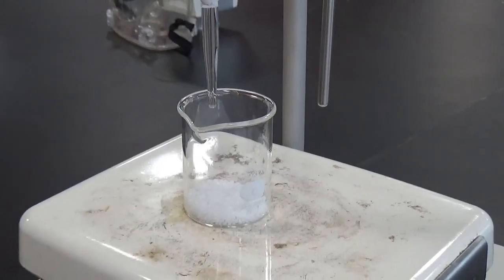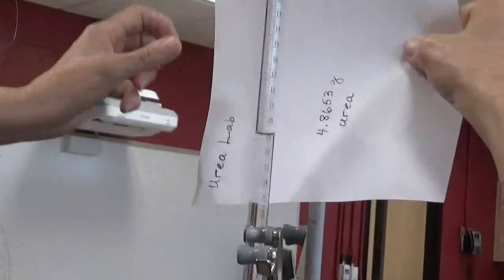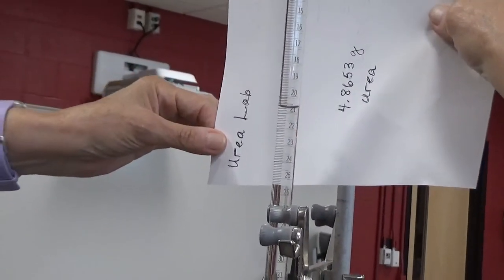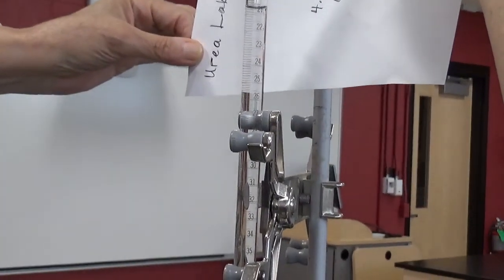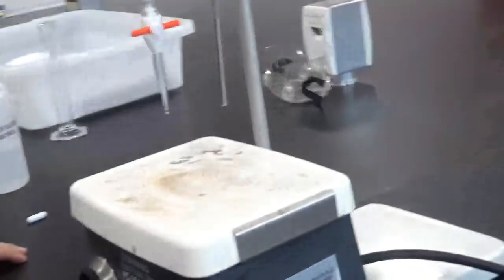Actually, I may have forgotten to flow the water through the tip. So I think I'm going to do that, and I'll have to retake that initial volume. Sorry about that. So there we go. This happens sometimes in lab. We're just going to cross it out with a single line, like we are always saying you should do. So that's 20.69. I would say 20.69 is the initial volume.